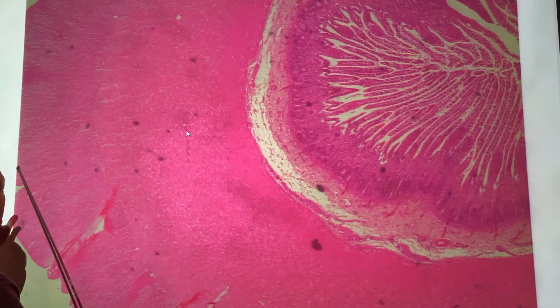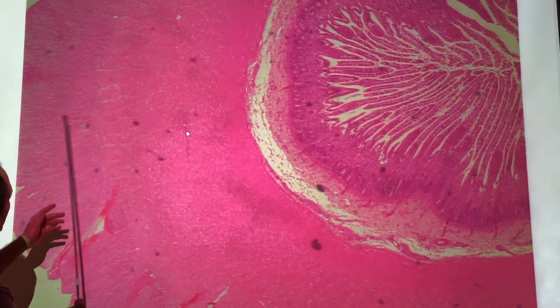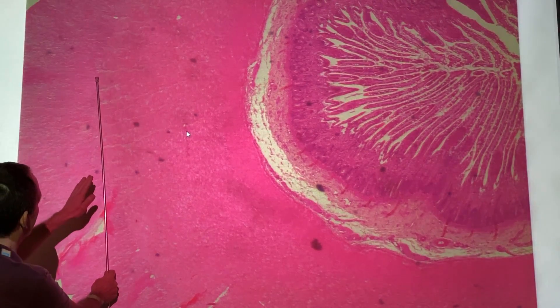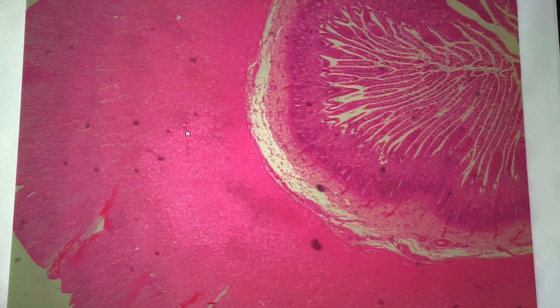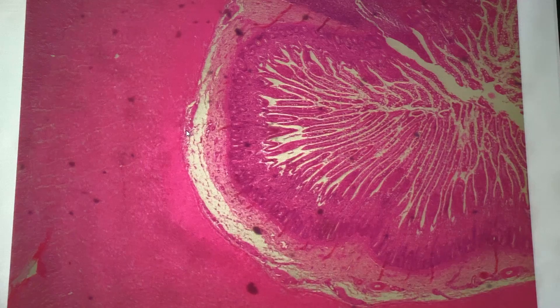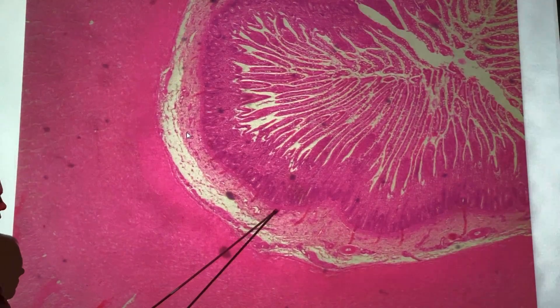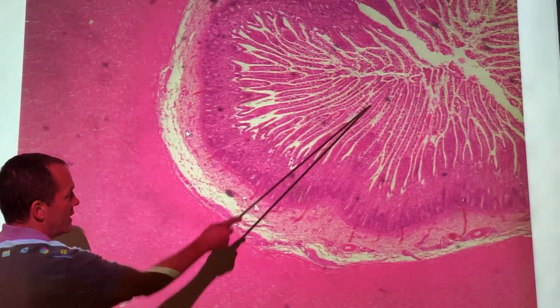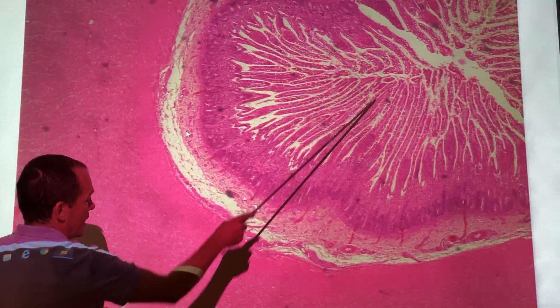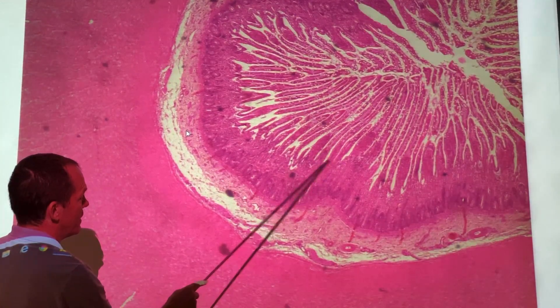You see a really thick muscularis layer out here. I can't really discern between the circular and longitudinal — I think there seems to be a bit of a divide right there. As we move inward, we're going to run into the submucosa, which has that arrow on it right now. This is the submucosal layer. Then you see these really nice big villi extending out there, and if we zoomed in on those, you'd be sure to see a simple columnar epithelium.